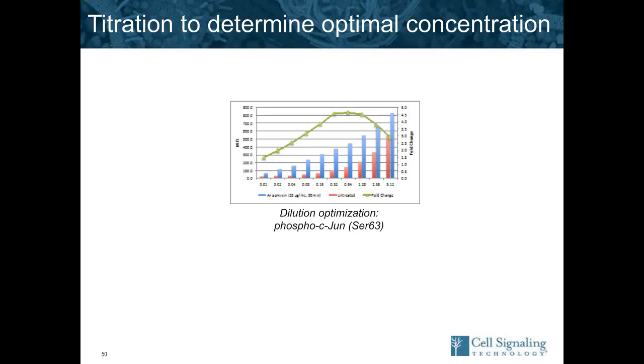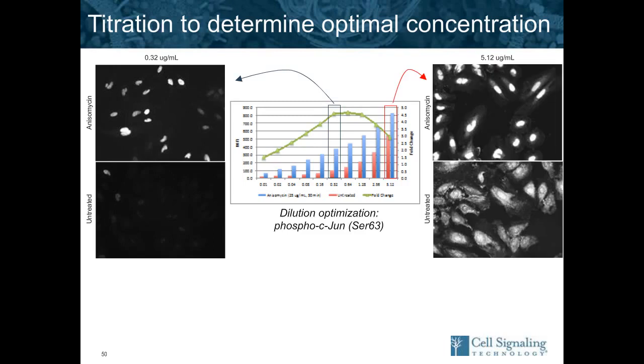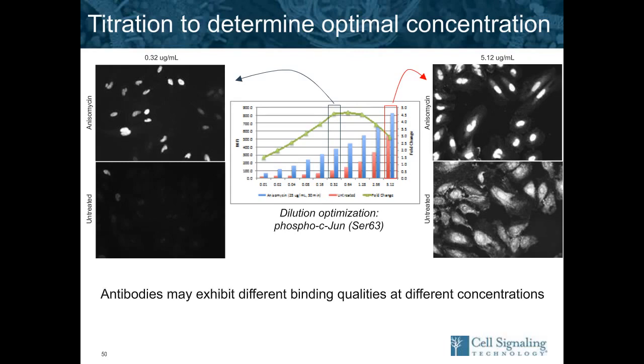non-specific signal. In the graph shown here, the blue is the signal in positive cells, and the red is the signal in negative cells. These were done on a high-content imager. If you look at the optimal concentration, you see nice, clean, positive stain in the positive cells and very little signal in the untreated or negative cells. If you were to go to a higher antibody concentration or a lower dilution, you would actually see a lot of non-specific stain. So it's very important to work in the optimal concentration of the antibody, and we provide all this on the data sheet.